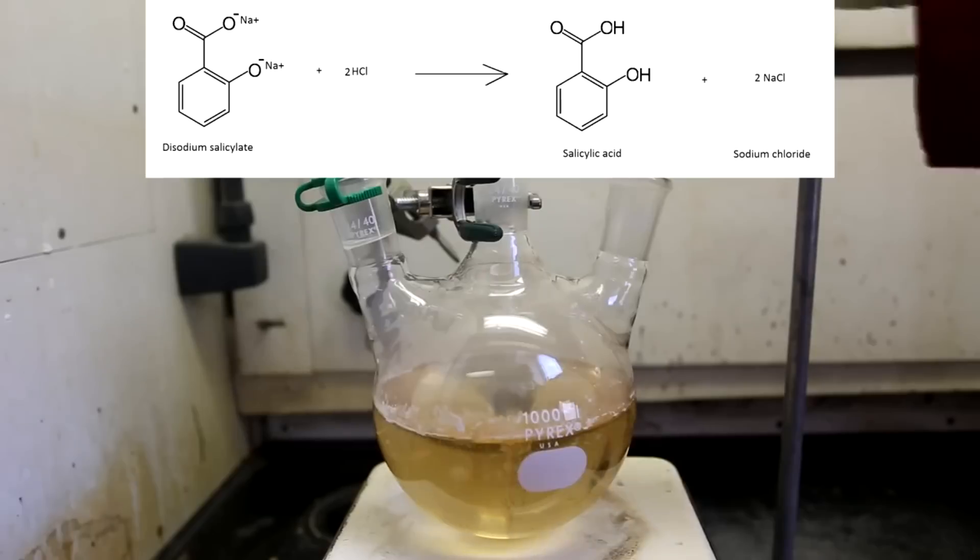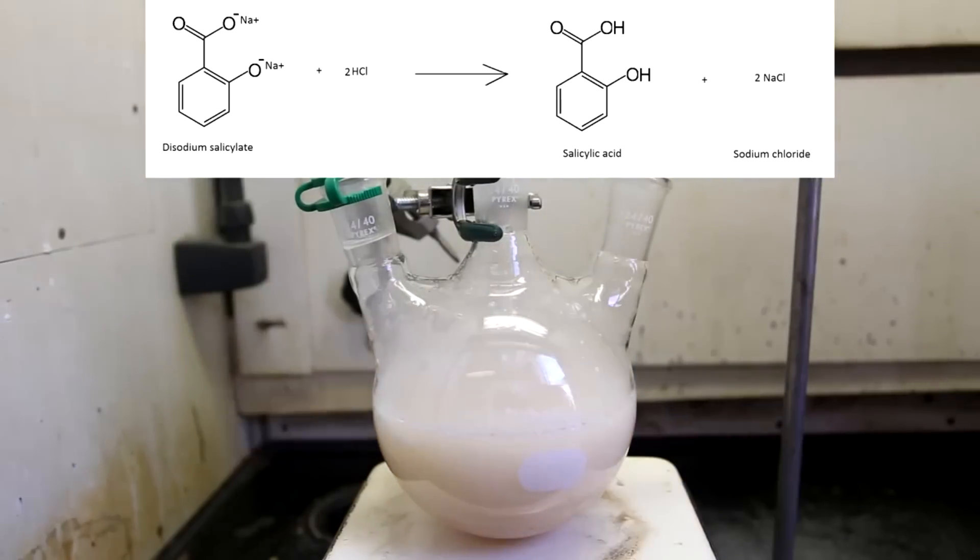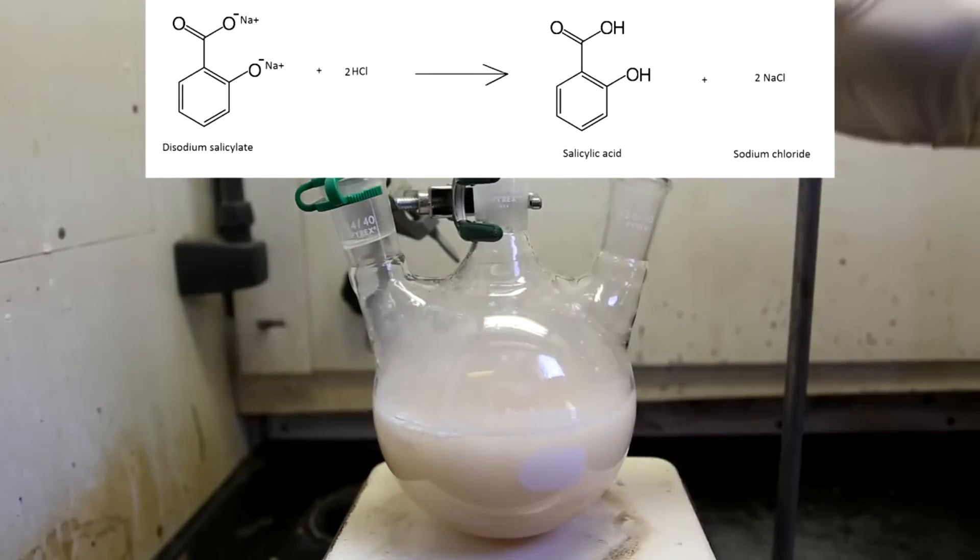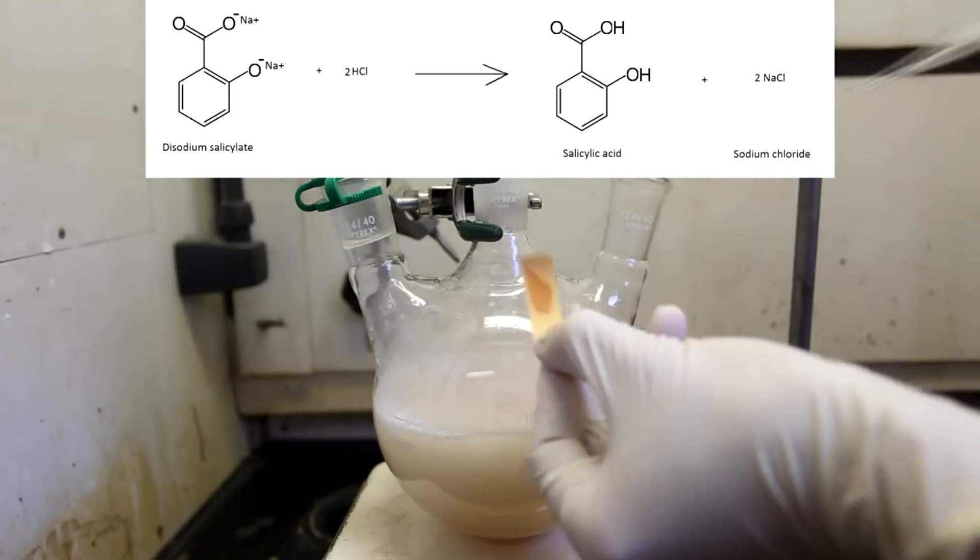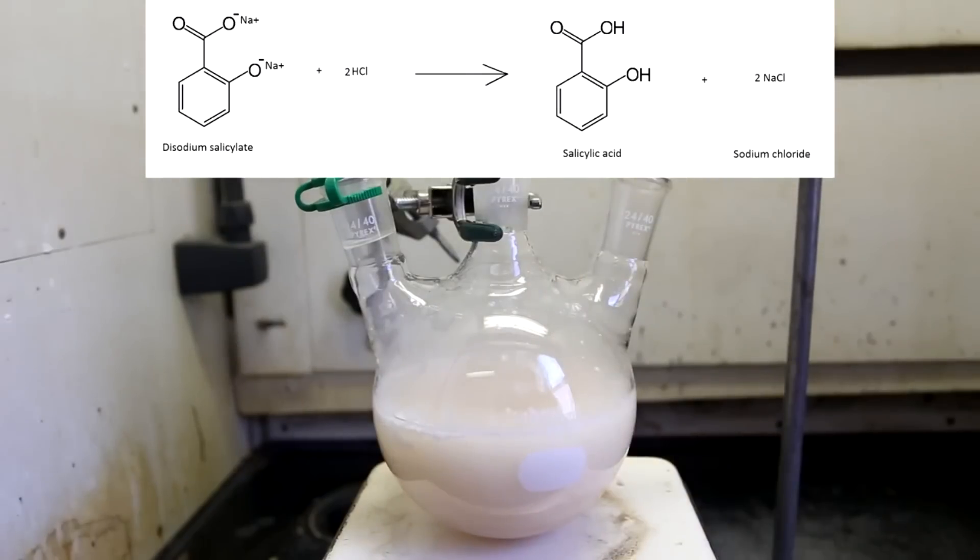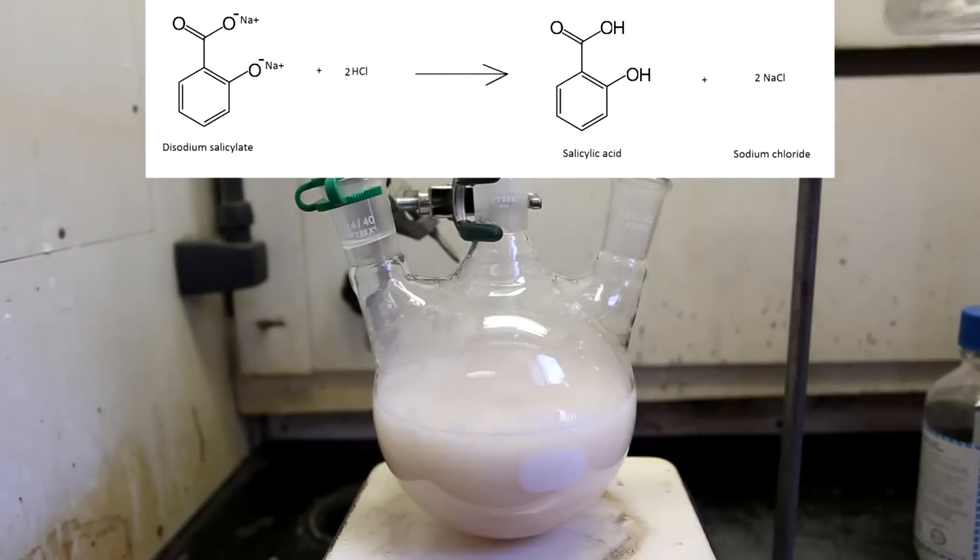Unlike its sodium salt form, salicylic acid is almost insoluble in water. So immediately upon forming it, it precipitates out of solution. It is not shown here but the hydrochloric acid also regenerates acetic acid from sodium acetate.